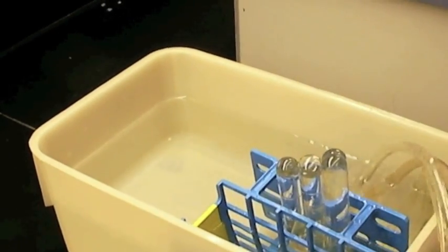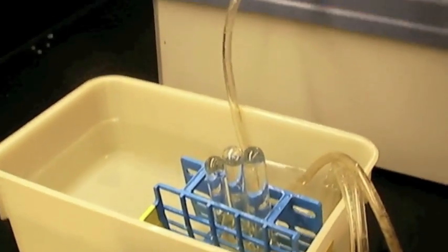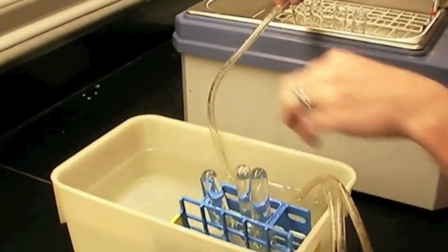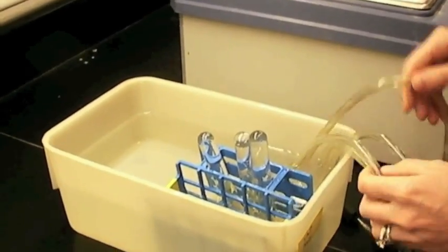Something else important to remember is that you need to know which reaction tube is hooked up with which collection tube. So you need to make sure you know which tube is running to which tube.